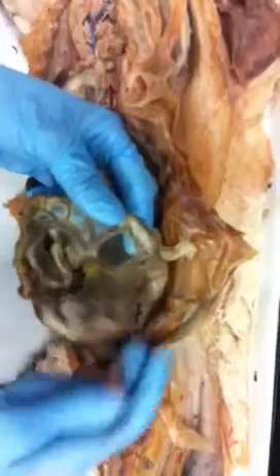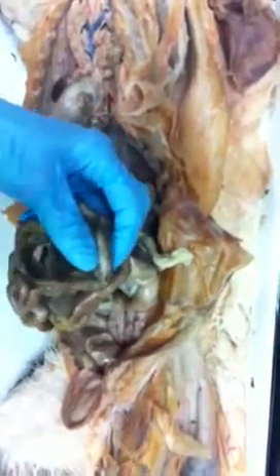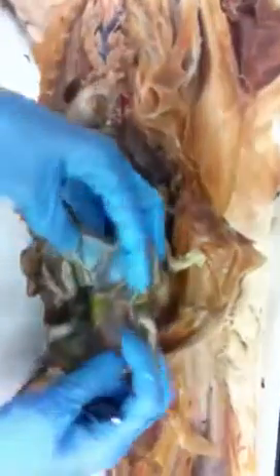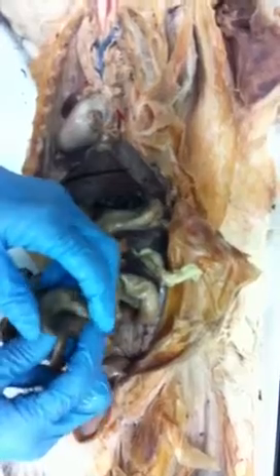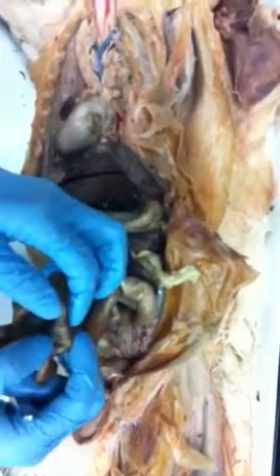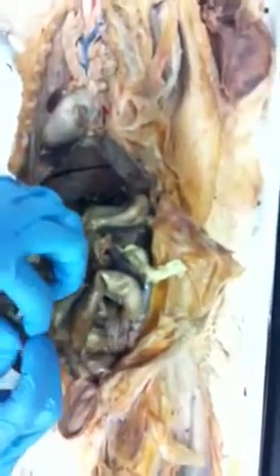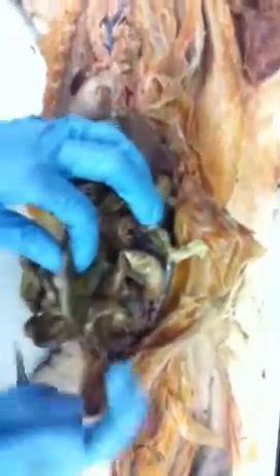And your small intestines isn't just tied up in a knot and stuffed in there. It's actually held in a very specific orientation, and that's what that membrane helps to do. Because you don't want it to have to be all kinked. Right. I'm sorry? Because when it kinks, then you get impacted, you get blockages, and it can actually get necrotic, and they have to cut it out.